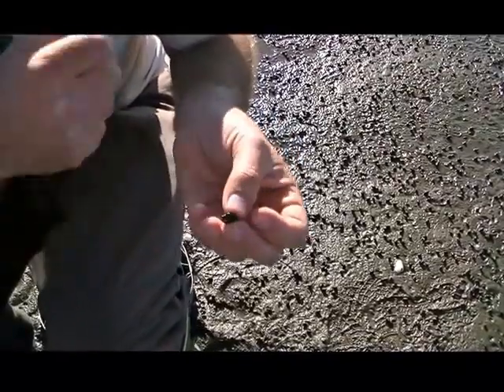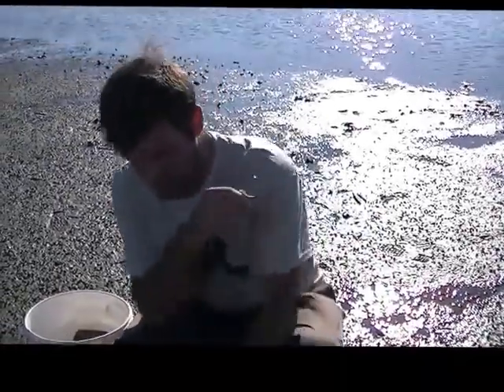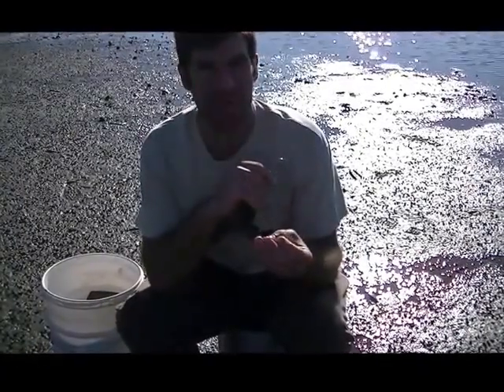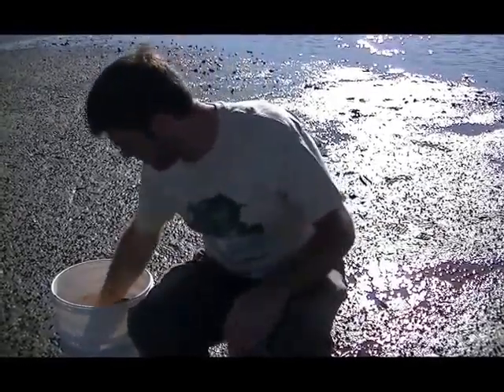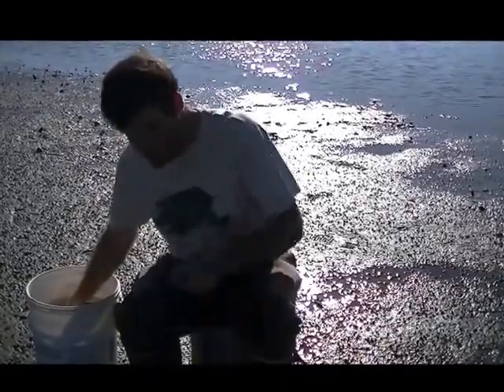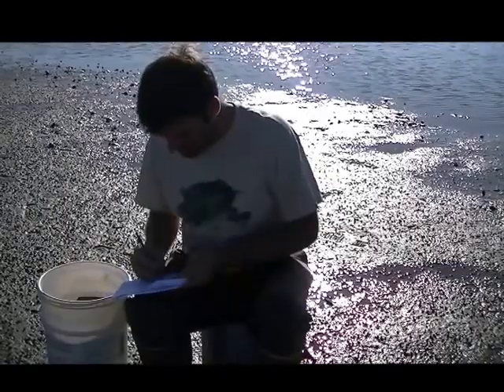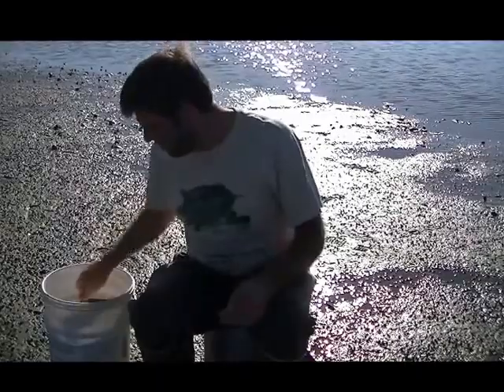The cysts could be confused with sand if the shell had adhering sand, but since you've rinsed it off, that's unlikely. If you think it's sand, you could do a little brush and it would come off, the cysts won't. So now that we're done with that snail, you can drop it down. If you're away from where you originally collected, you can put them in a bucket and then transfer them down, however you want to do it. You can also take them back to the lab and do it under a dissecting microscope. So I'm just going to record that no cyst on snail and no cysts on the operculum. And that's how you do it.